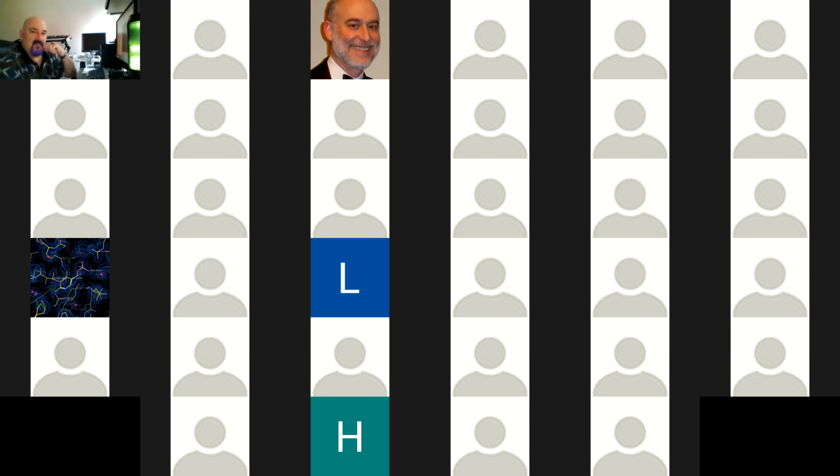If you have NUS data, you do the conversion, you get the file, and then when you say start up in process mode, it automatically fills the menu in. Is that correct? Yeah, so let's look at an example like that. We have one. So NUS 2D.